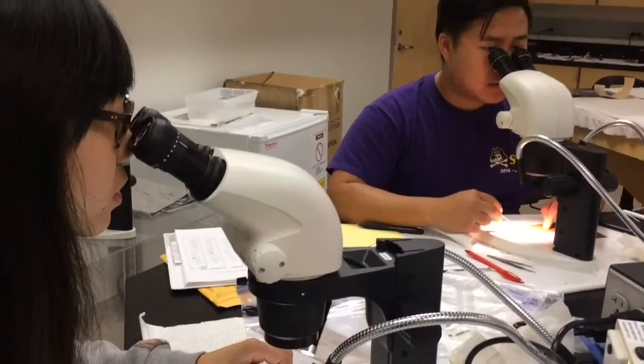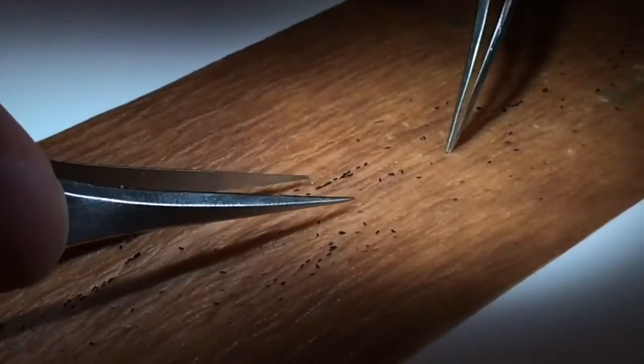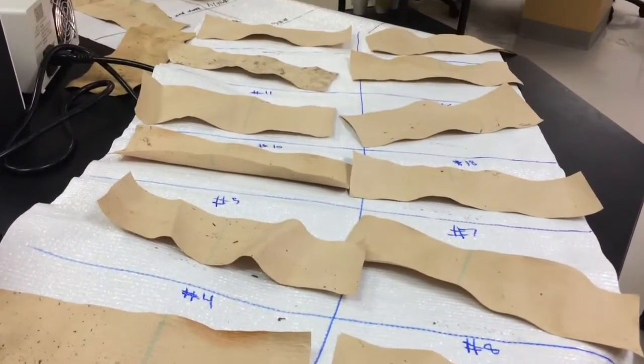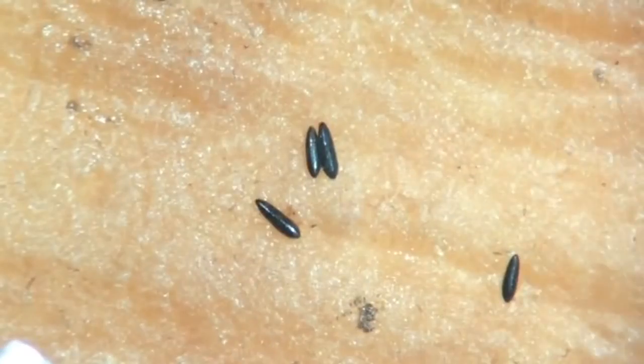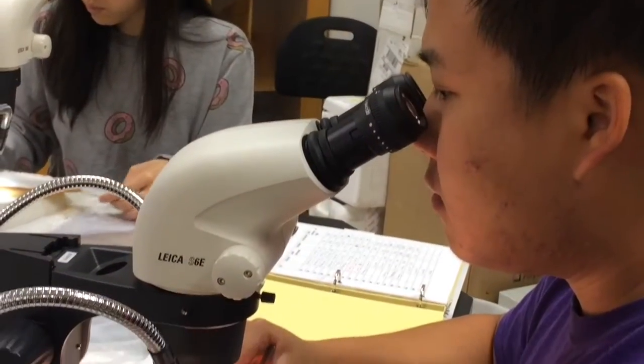We set out mosquito traps and the guys go out and collect them and bring them to me. I count how many eggs are on the mosquito strips and then let them dry. After they've dried, we put the egg strips into water and rear them to adults. The adults are then identified to species.